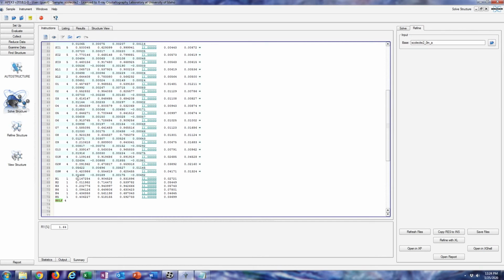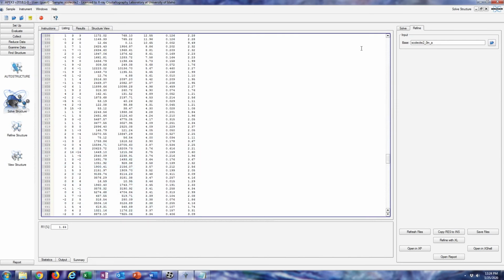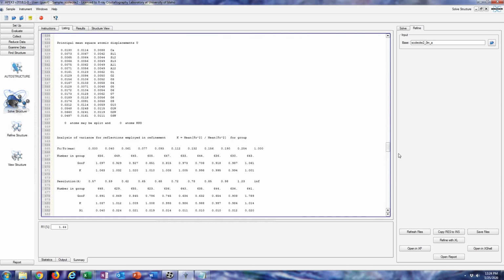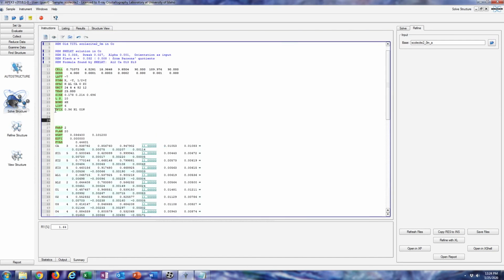And make sure, these are hydrogens, so you don't want to use the anisotropy command for that either. It's just so low electron density. That's why it doesn't behave so well in these refinements. It has a very low scattering factor. Alright, use the proper names.